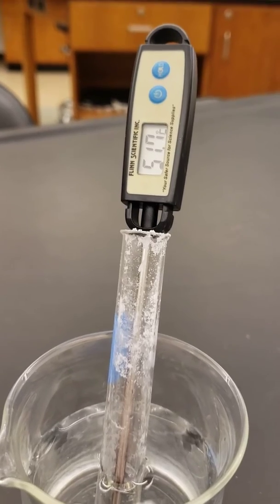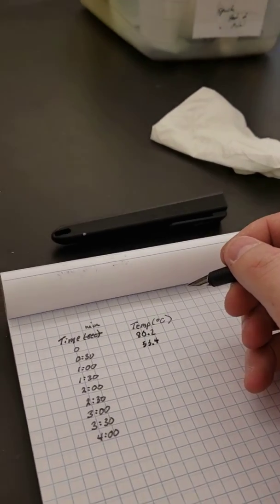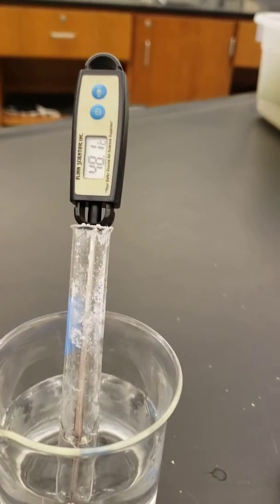53.4. As you can see, it's dropping fairly rapidly.